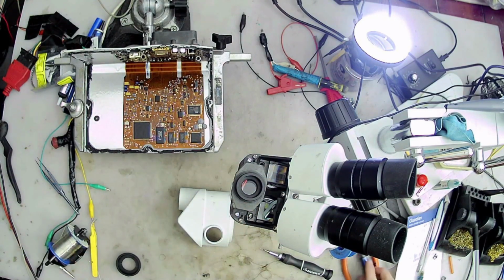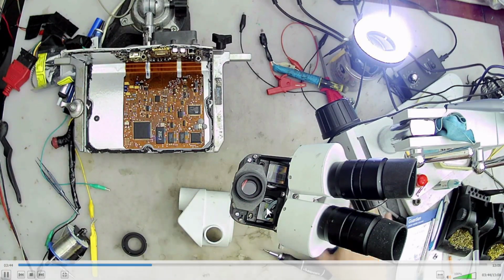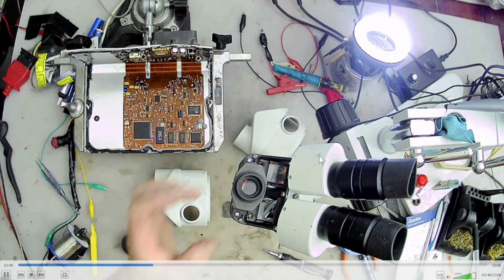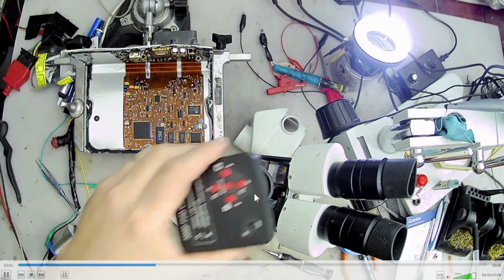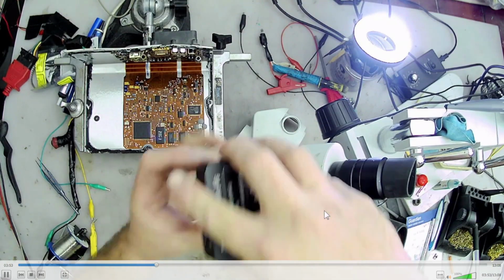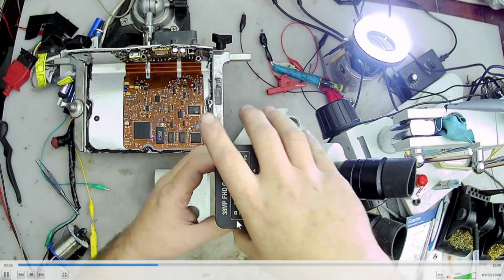But that's the piece for the camera there. It reflects off of this, so I guess the light comes in through the bottom and it reflects off of this and then to this. It's pretty neat. It's a pretty neat setup.